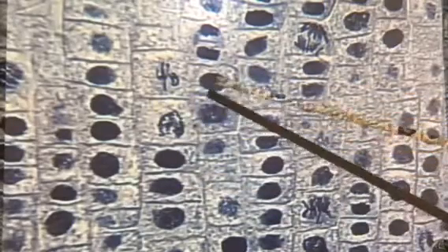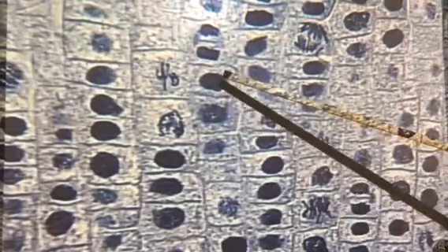Again, cell walls, we see the box. Here's another cell right here. And these are the nuclei that we see. Now we can see that not all things are going on the same in all of these nuclei. So let's work our way up from interphase, and we'll go through the four stages so you know what you're looking for and what you're hunting for. Interphase first. Here's a classic interphase right there.